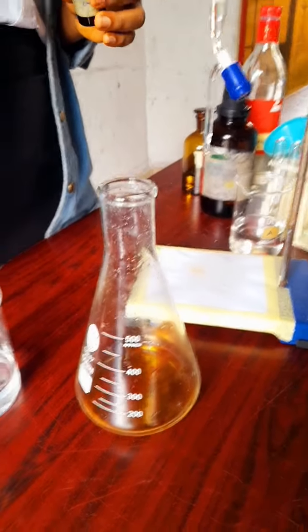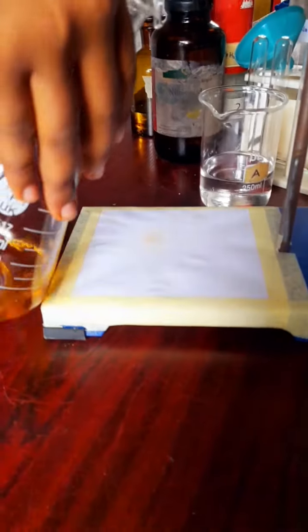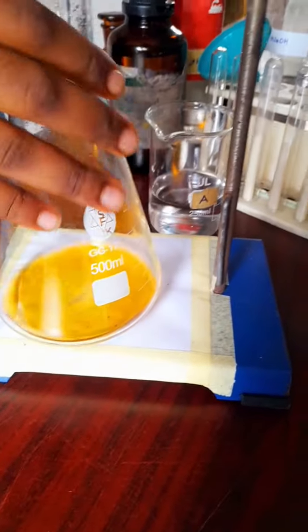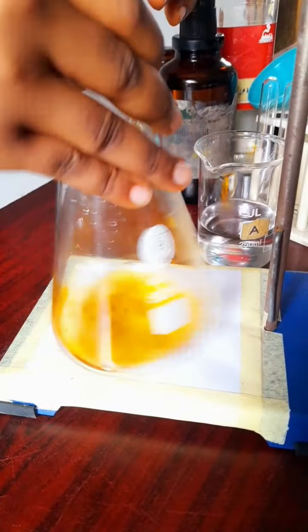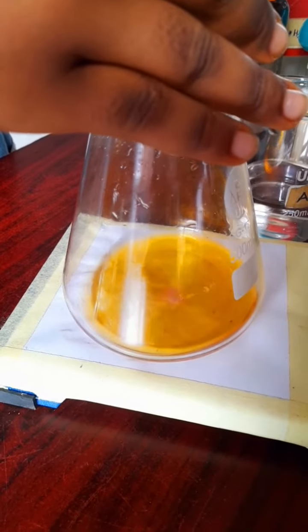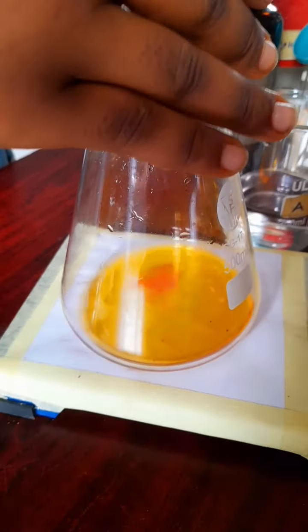So ensure that anything you're putting inside there does not roll or rub on the walls, because you want to be sure that whatever is coming out of the burette is inside the solution, not on the walls, because the ones on the walls may not roll inside it, and then will account for less value in the conical flask, but more value in the burette.